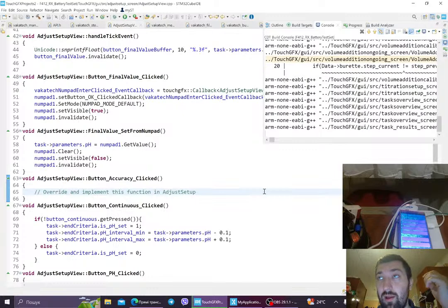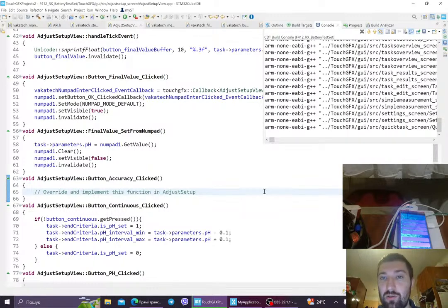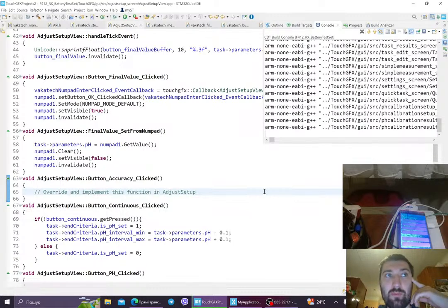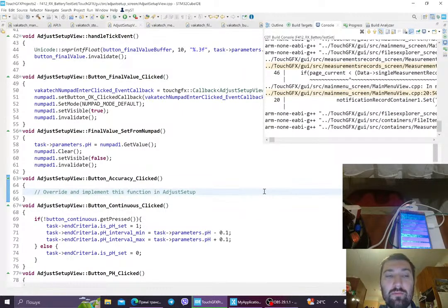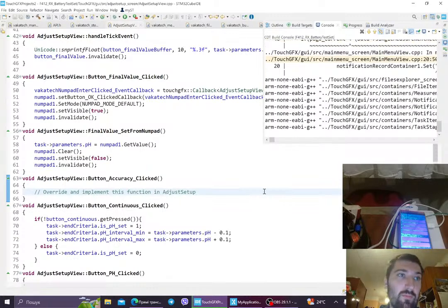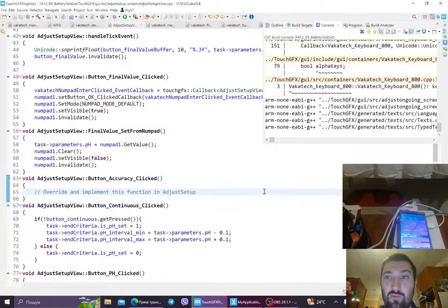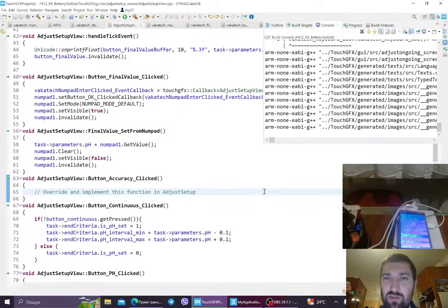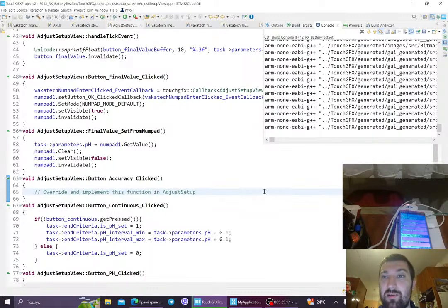I have 16 megabytes that I use to store TouchGFX data, like all the graphical data and so on. For this board, we are using W25Q128 chip. This is a NOR flash, and yeah, in quad SPI mode. So I made a memory mapped mode. It all works. I created my custom downloader as per tutorial that I saw. Where did I see it? Yeah, like the STM32 official one. There's a tutorial on how to make it. I can guide, if I have the time and if somebody needs it, I can make a tutorial of how to do it. But anyway, so what do we have more?